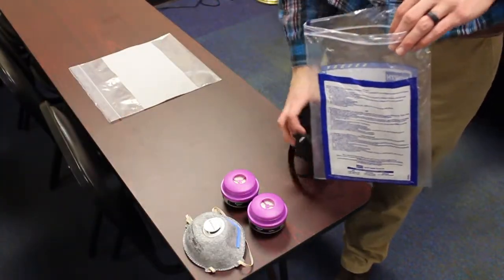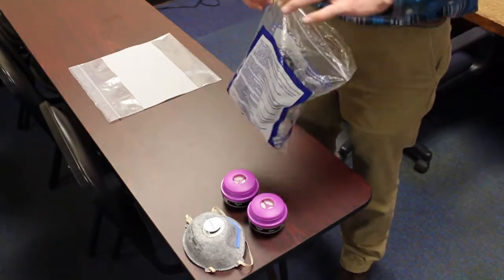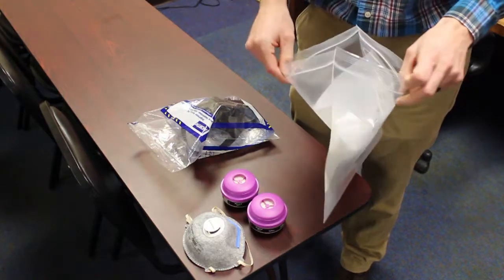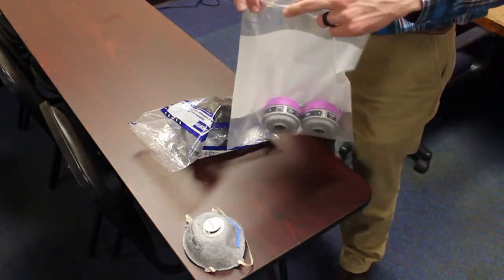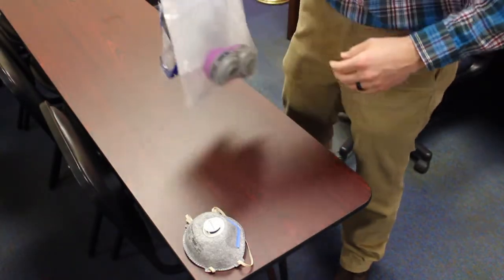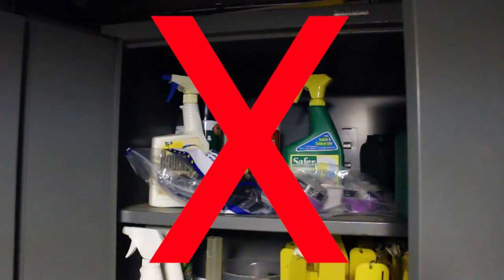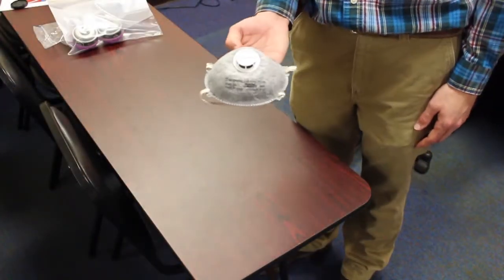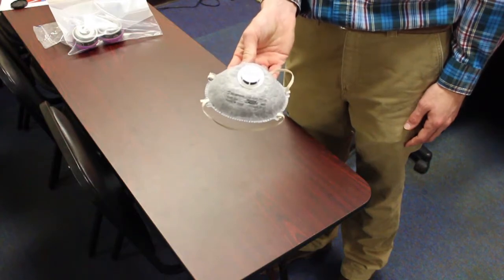Store your clean respirator in an airtight bag or container. Be sure the respirator is dry before you put it away. Store your cartridges separately so as not to contaminate the clean respirator. And store both away from sunlight, moisture, extreme cold, extreme heat, and dust. And don't store them around chemicals. Take special care with the particulate N95 respirators, not to store them in a way that damages the shape of the respirator.